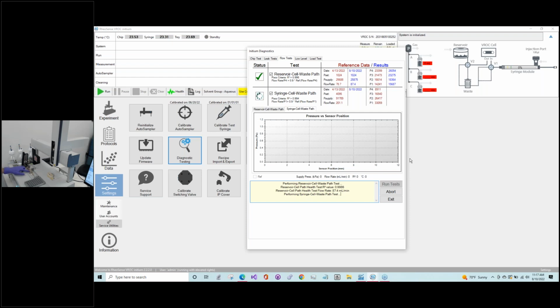So the next one will be moving through the syringe cell waste path. So now we're going to make sure there's nothing plugging up PEEK tubing coming out of the test syringe, and then the alternate positions of the switch valves. Okay, so everything looks good. And then we'll do one sort of final thing here on the diagnostics.